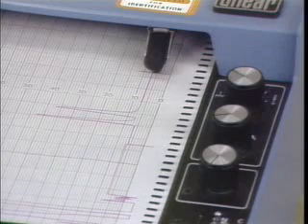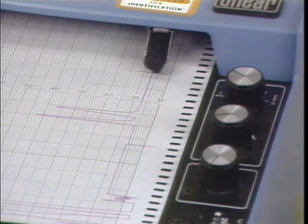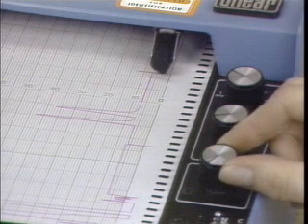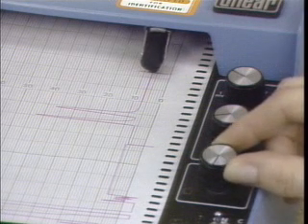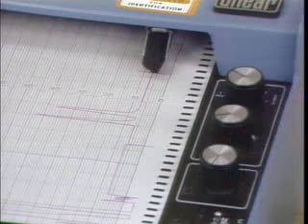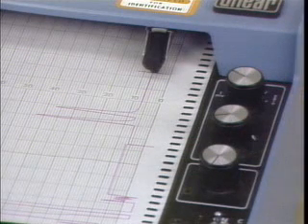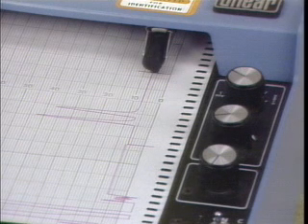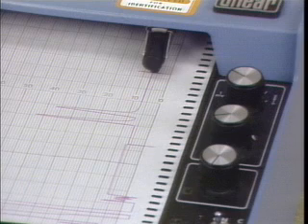The baseline is set on the recorder using the pen adjustment knobs. The baseline should be set slightly above the edge of the paper in order to accommodate any drift while the chromatogram is being recorded. If accurate peak heights are to be measured from the chromatogram, the baseline must not be readjusted when a peak on the chromatogram is being recorded.